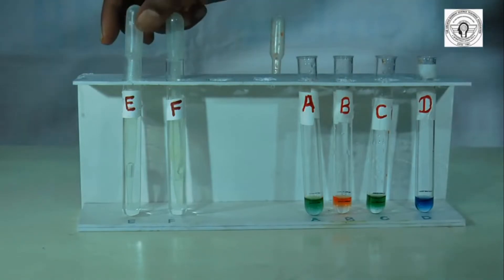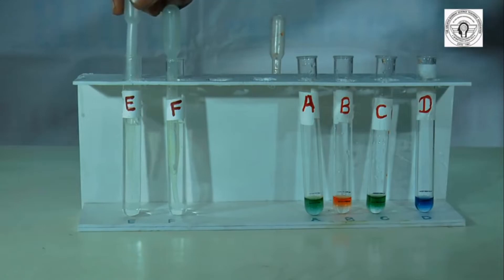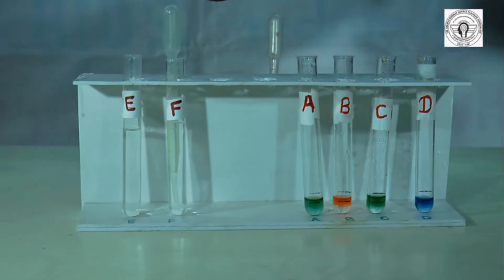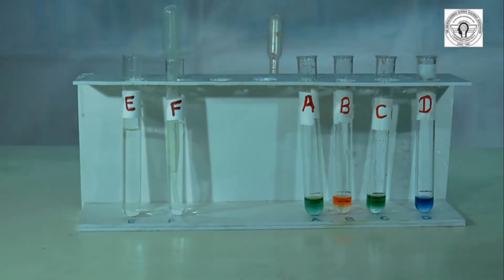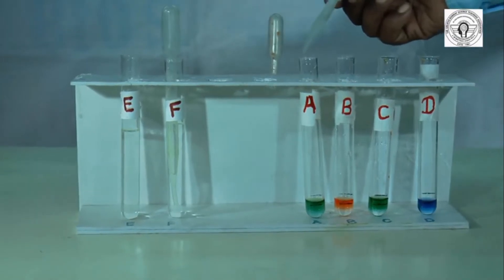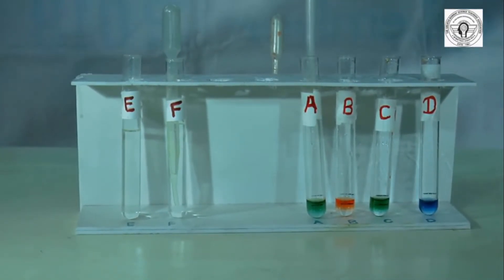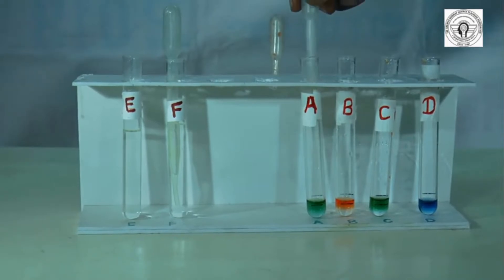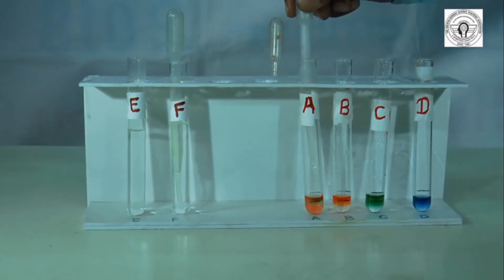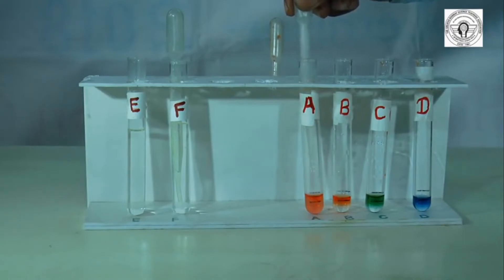Now from test tube E, take another solution with the help of the dropper and add it into test tube A till the second mark level. You have to observe the color change.